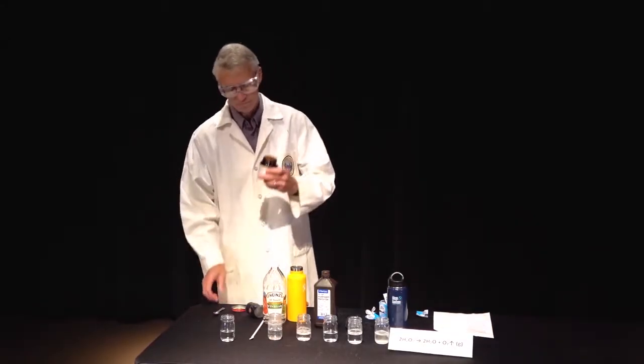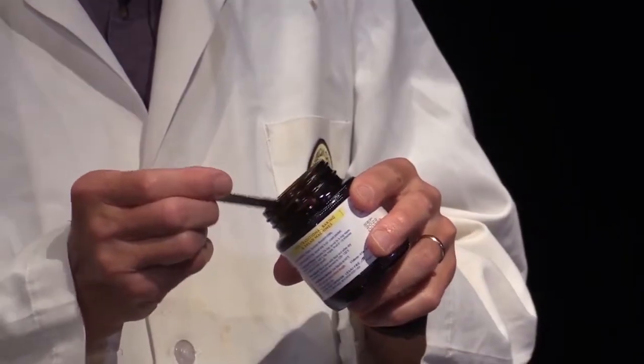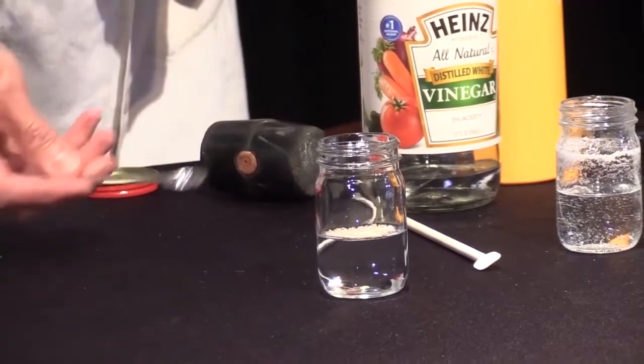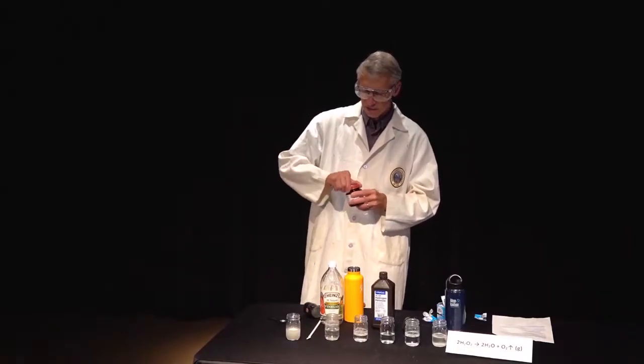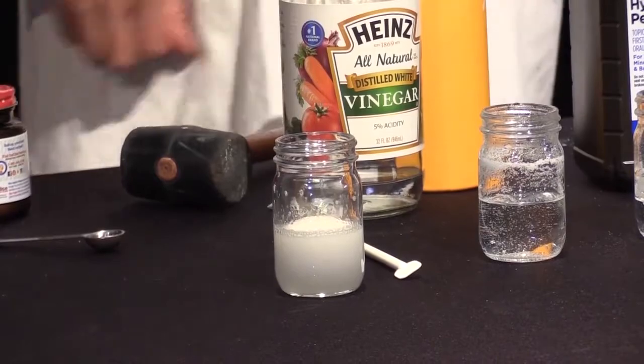And you can find this, most people who bake have this in their refrigerator. You take a little bit of yeast. It doesn't take very much of a catalyst to make a reaction go. And when you put the yeast in and swirl it a bit, it'll be a little cloudy. And if you look carefully, you'll see a lot of gas forming. All of a sudden, the oxygen is coming from the peroxide.